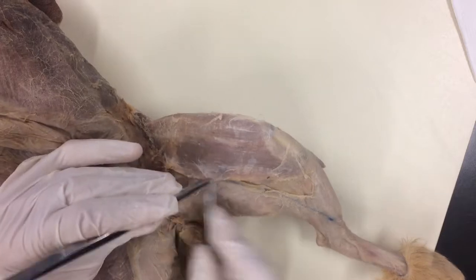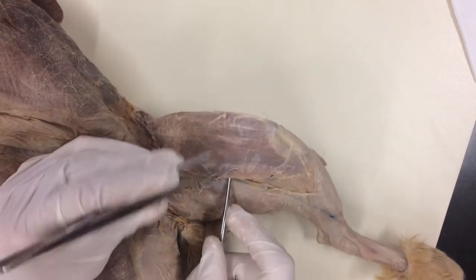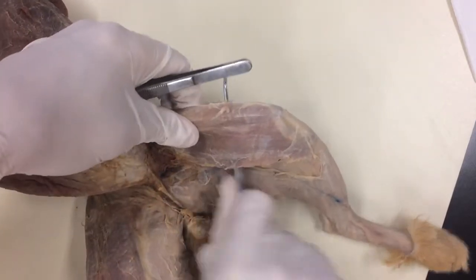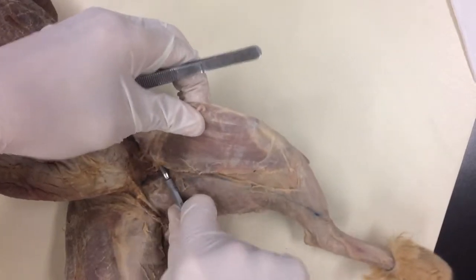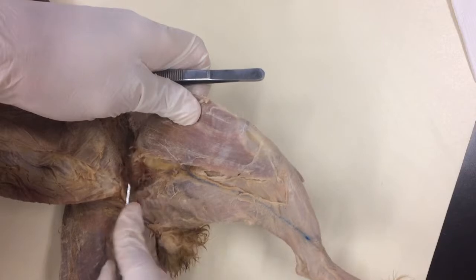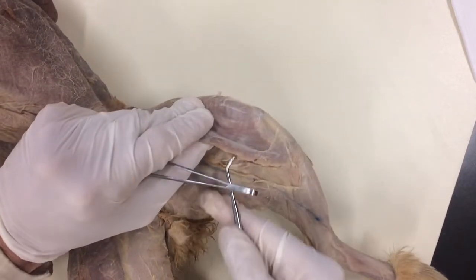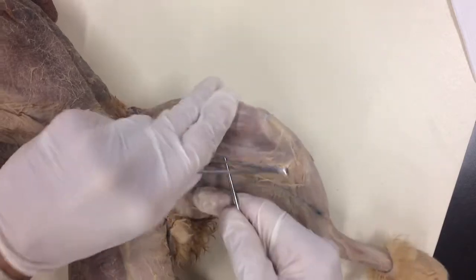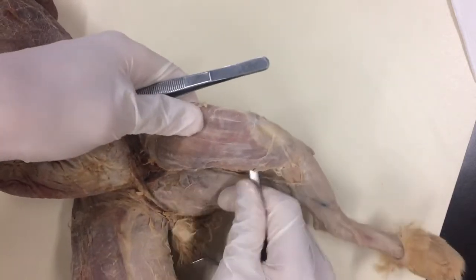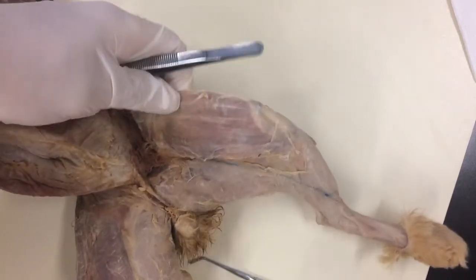I'm just going to worm my way through there. Be very careful not to hit that midline seam, and I'm all the way under. You can see I'm just working that back, working this completely clear. I'm going to switch to my scissors here — there's the knee. You can see I went right to it. That's Sartorius done.